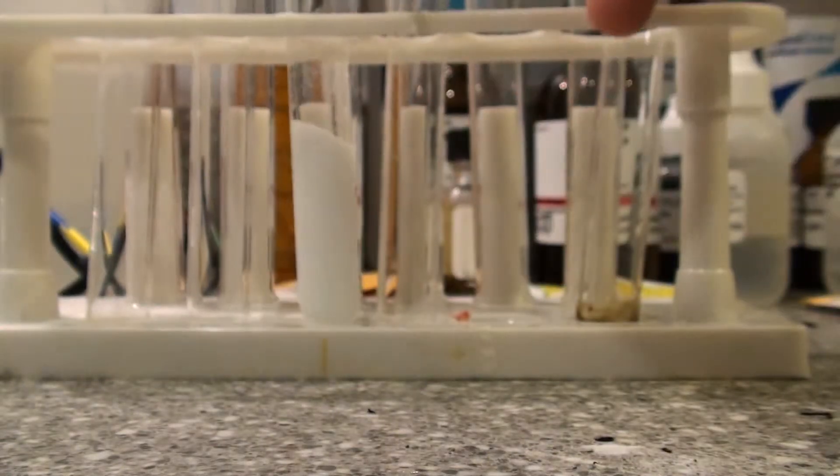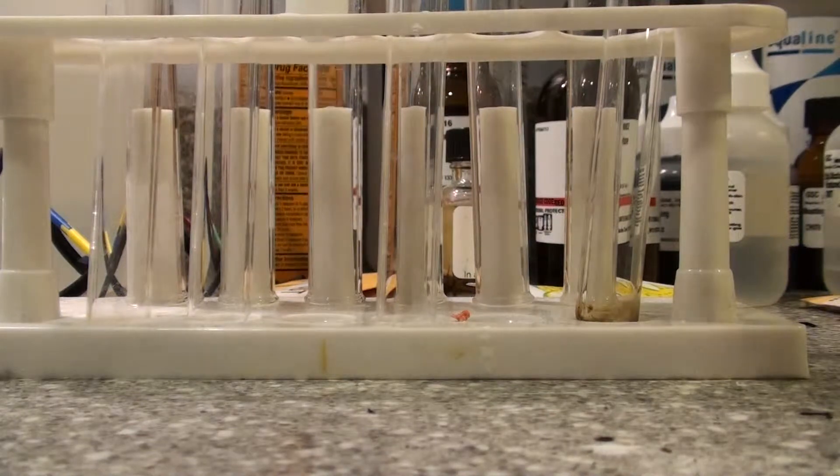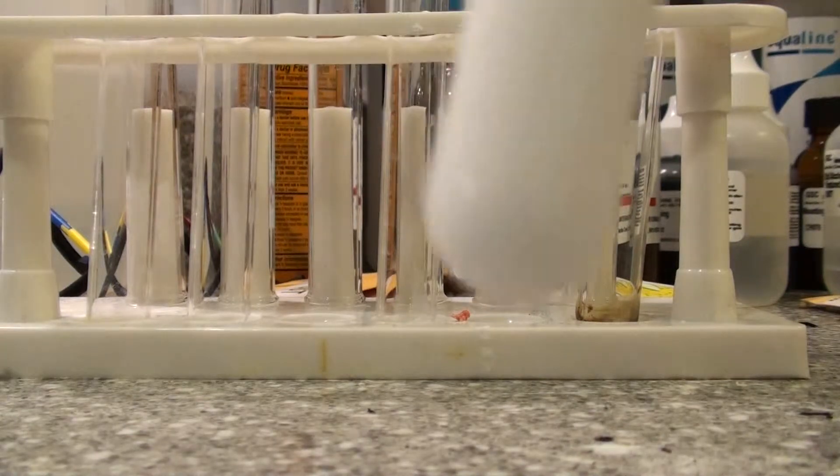Hi, it's Labmaster49 and today we're going to be trying to recrystallize the chemical Ammonium Chloride right here.